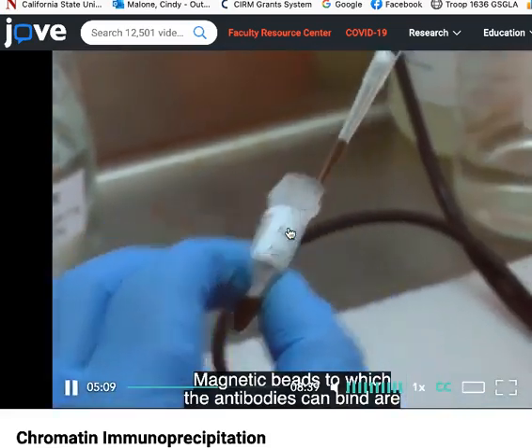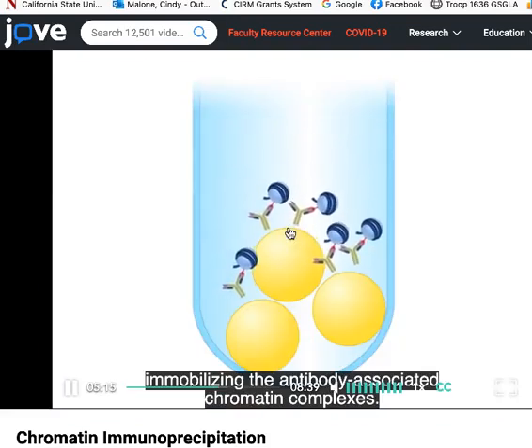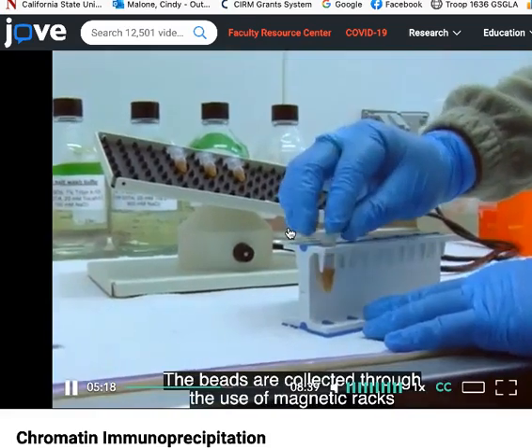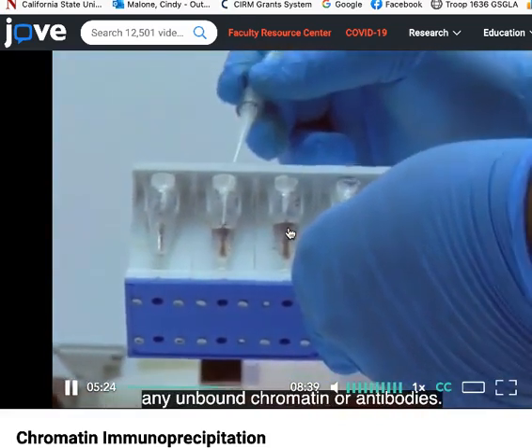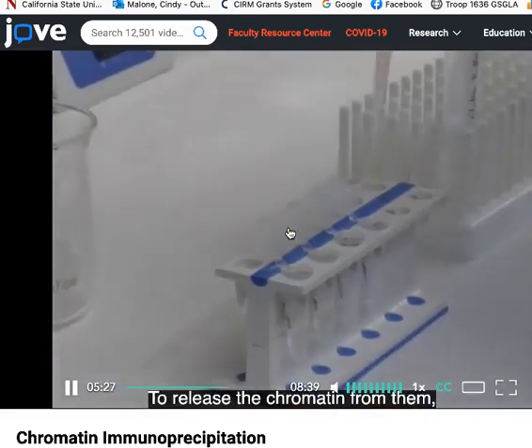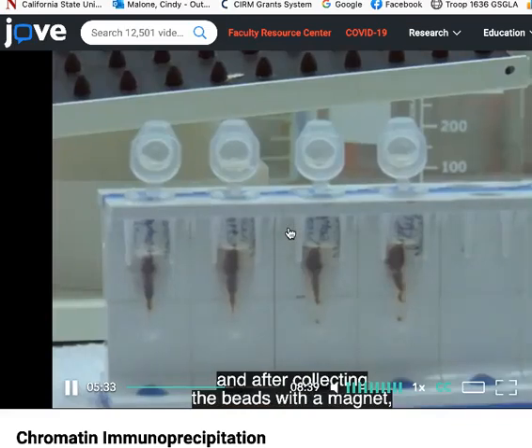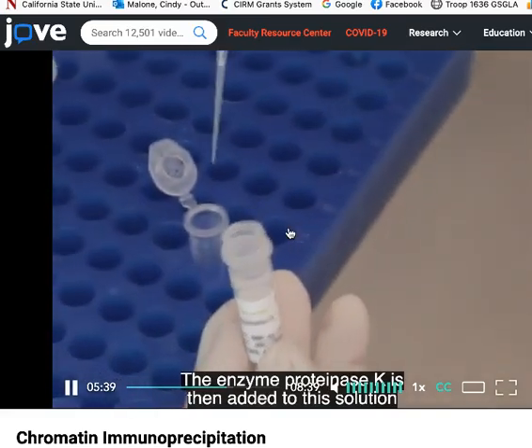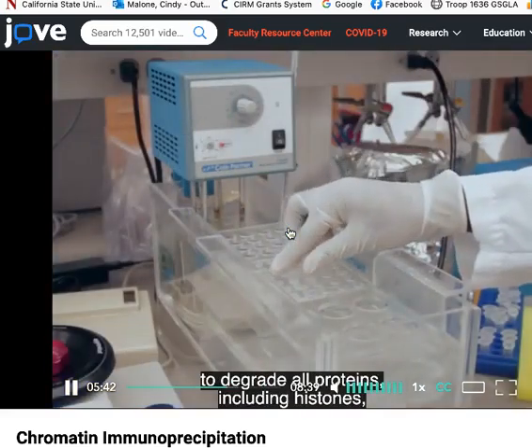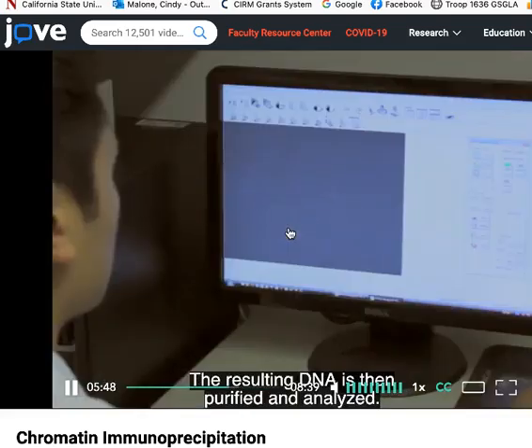Magnetic beads, to which the antibodies can bind, are then introduced into the mixture, immobilizing the antibody-associated chromatin complexes. The beads are collected through the use of magnetic racks and washed several times to rinse off any unbound chromatin or antibodies. To release the chromatin from them, beads are placed in a solution containing the detergent SDS, and after collecting the beads with a magnet, the supernatant is kept. The enzyme proteinase K is then added to this solution to degrade all proteins, including histones, so that the DNA component of the chromatin can be isolated. The resulting DNA is then purified and analyzed.